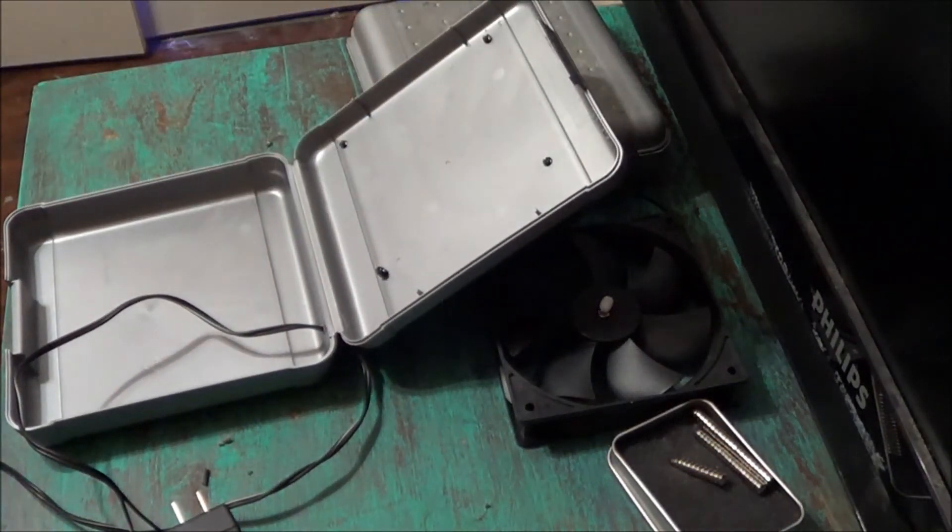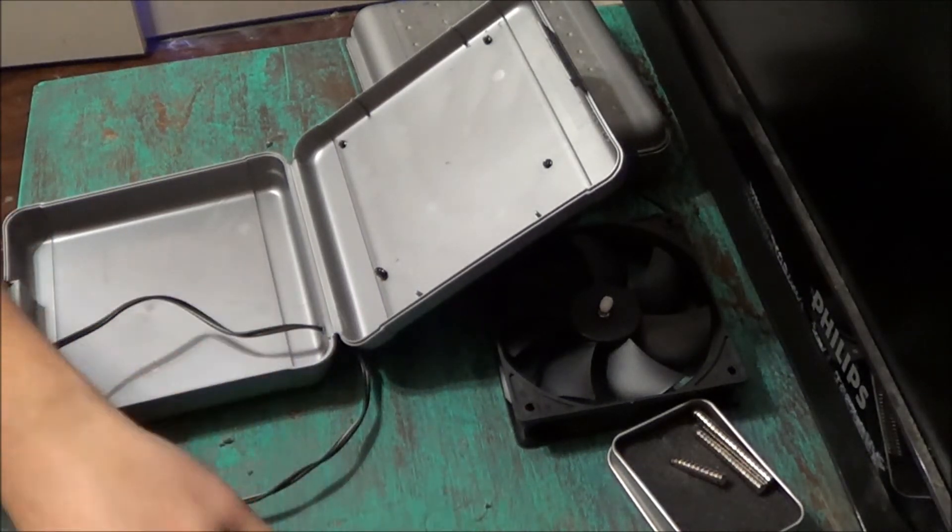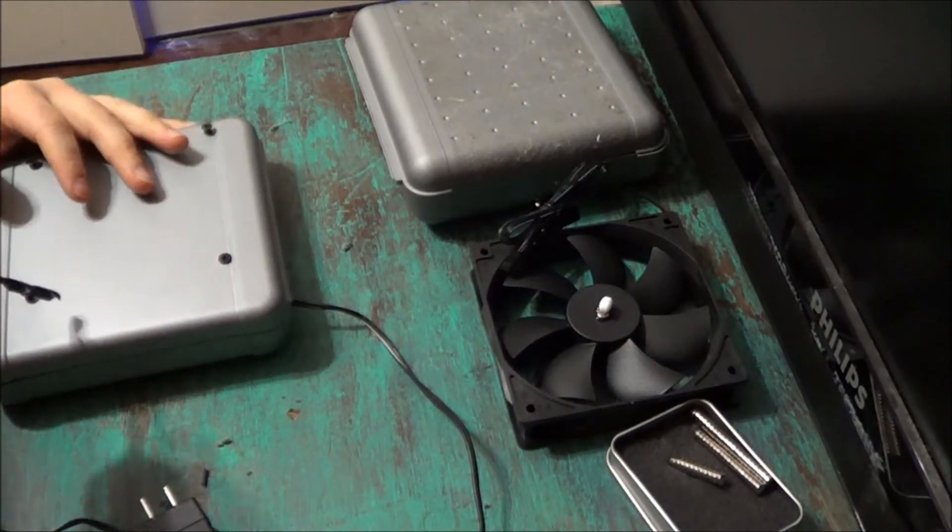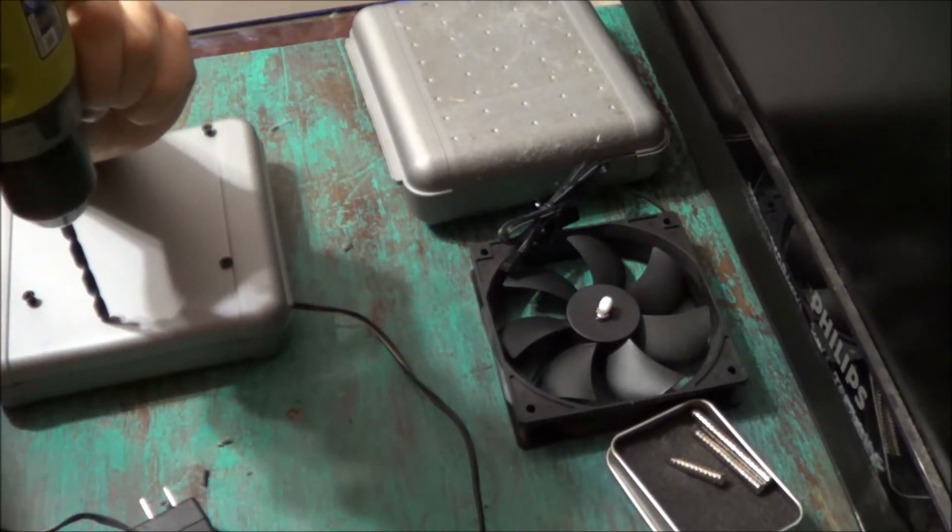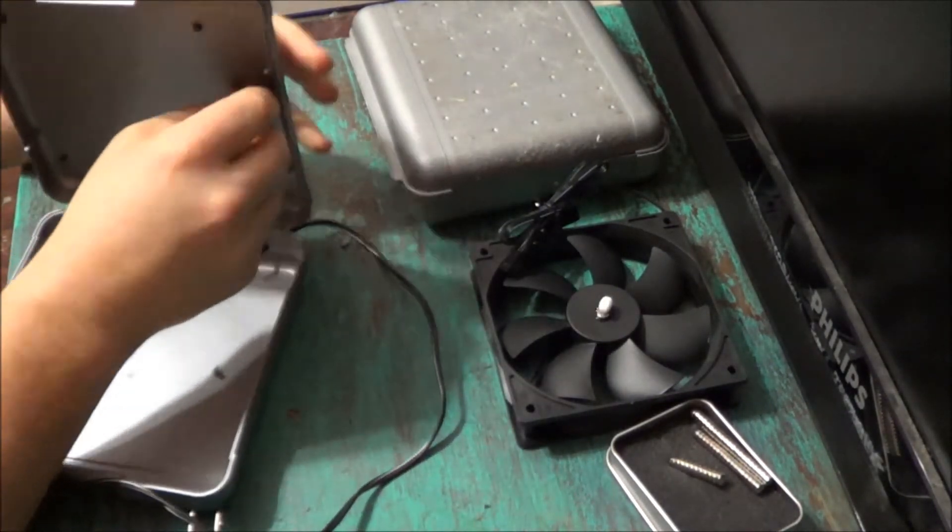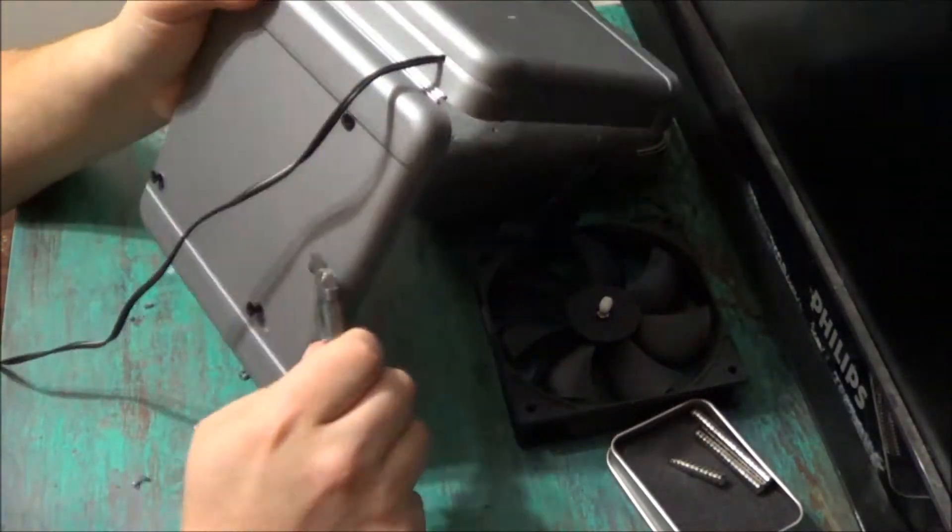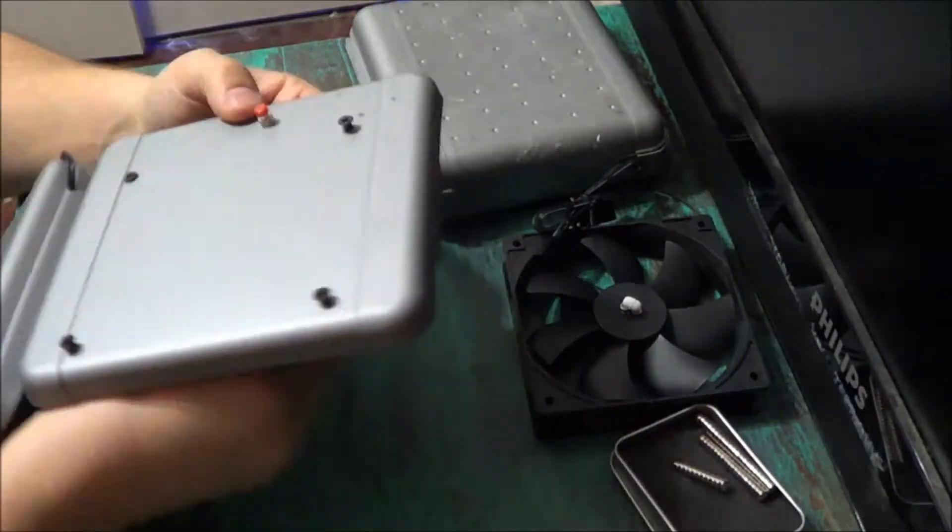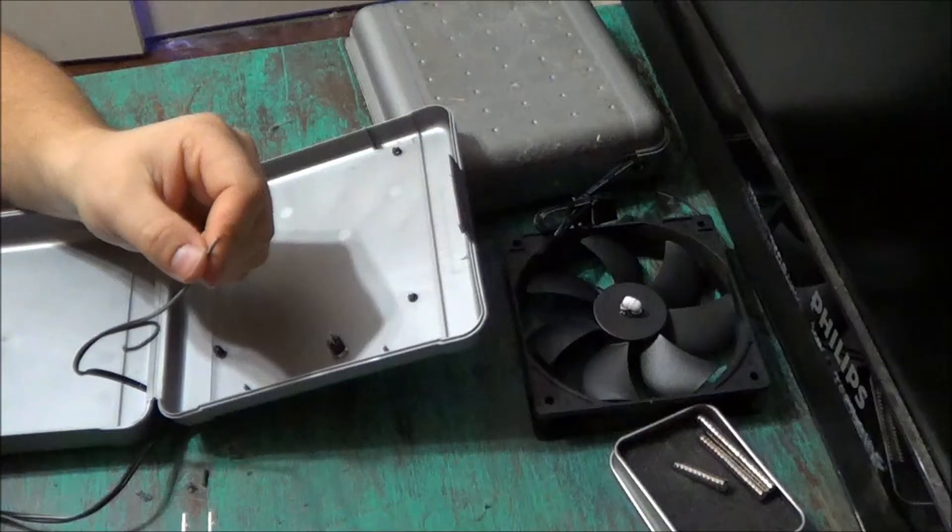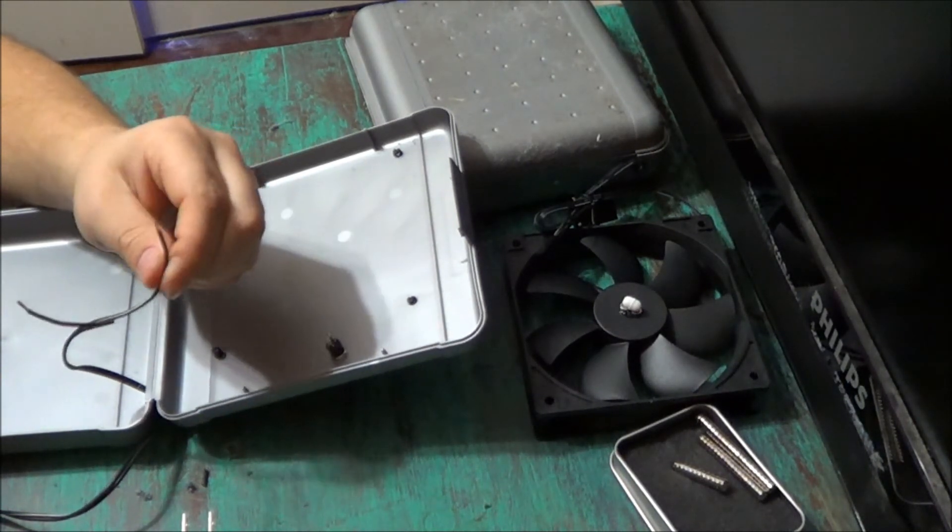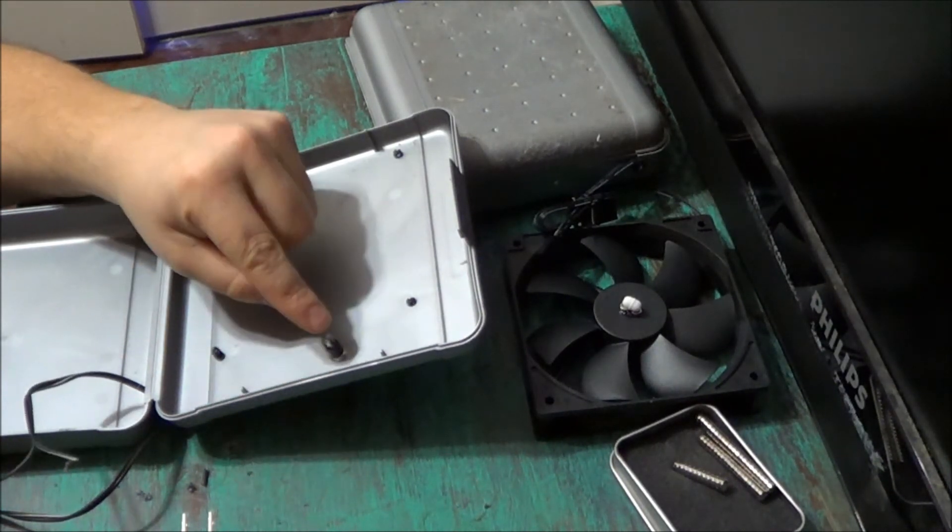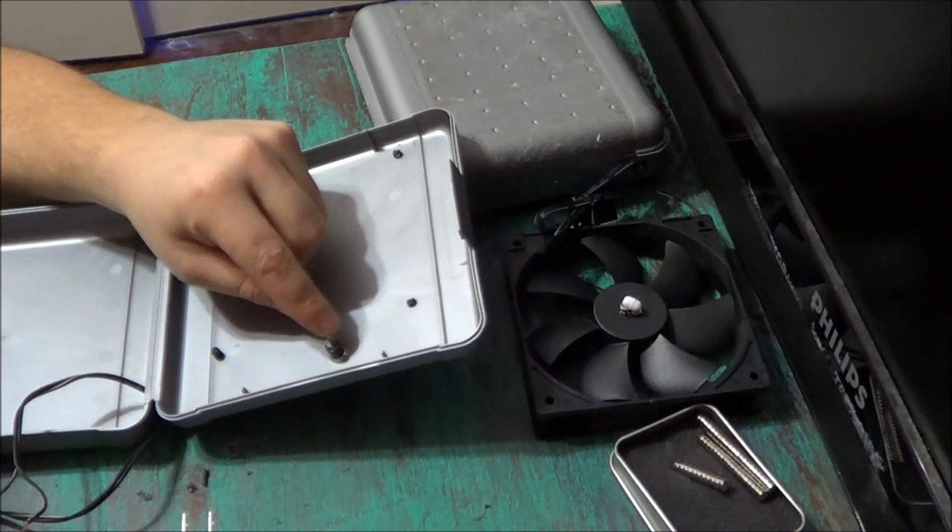Now I'm going to switch out my drill bits for the larger drill bit that fits the on-off switch. Select where I want to drill the hole for the on-off switch. Next I'm going to connect my wires to my switch. But I'm only going to connect one side of the power supply wire to one prong of my power switch. The other side will actually go to the fan.